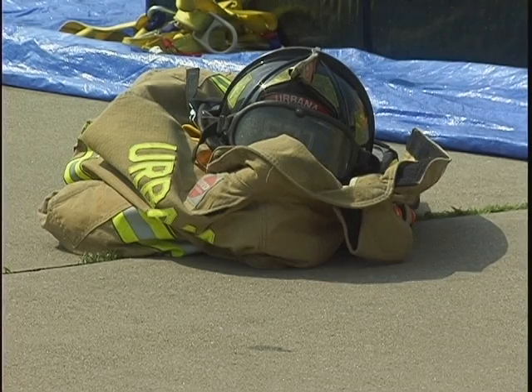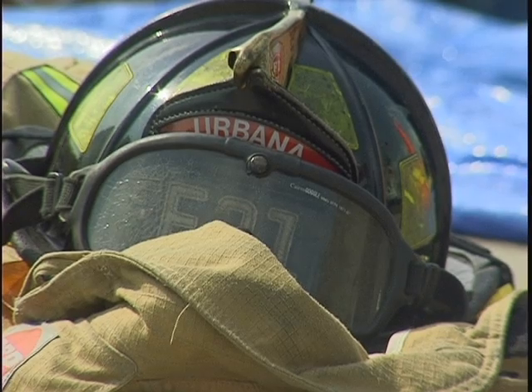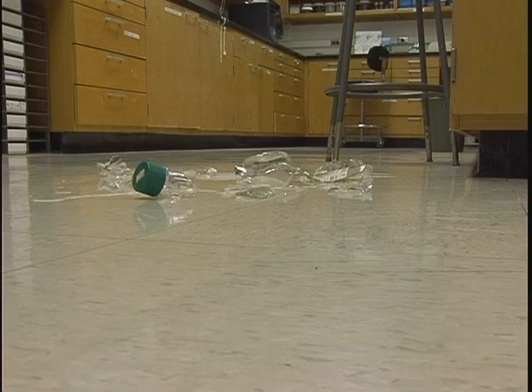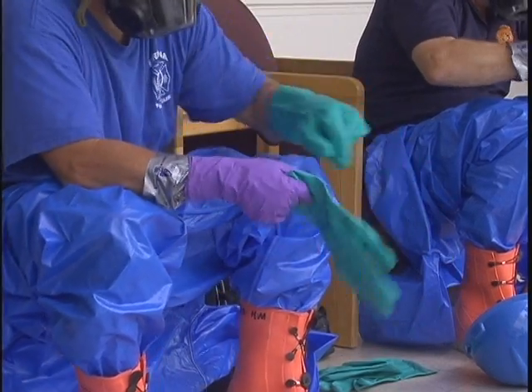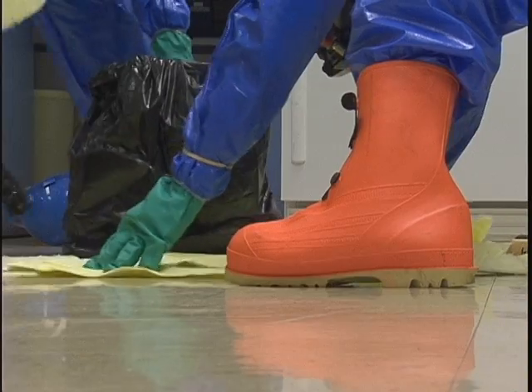While the department is used to responding to fires, they say they need to practice more uncommon situations, like a chemical spill. The team practices various drills, then critiques their performance. What we're doing is we're looking and ensuring that not only at the positive things, but also at the negative things that we can work on.